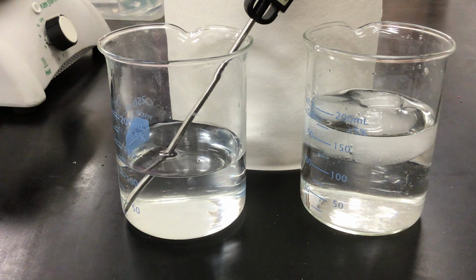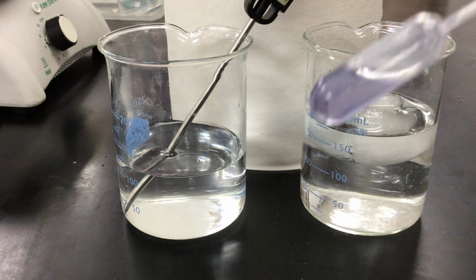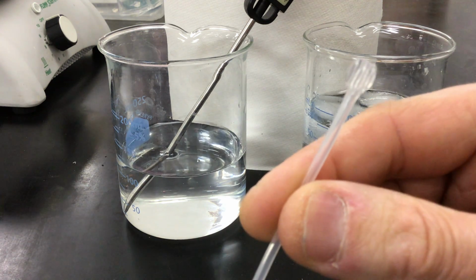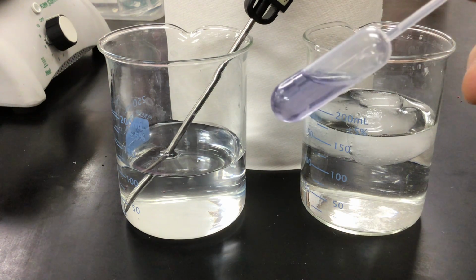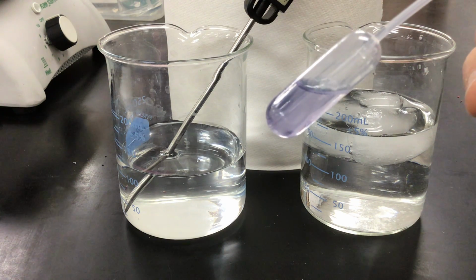All right, the fourth and final part of the LeChatelier's Lab is looking at a chemical compound called cobalt 2 chloride. Cobalt 2 chloride is inside of this sealed barrel pipette. I've sealed the end of it utilizing some heat and a clamp. And inside of this chemical compound, as you can see in solution form, it has this purplish color to it.